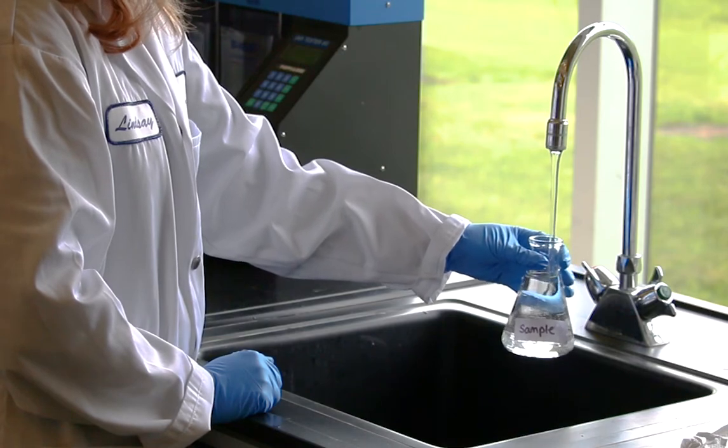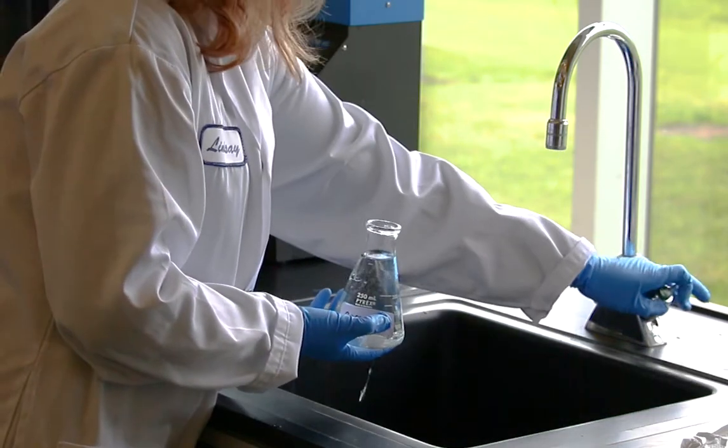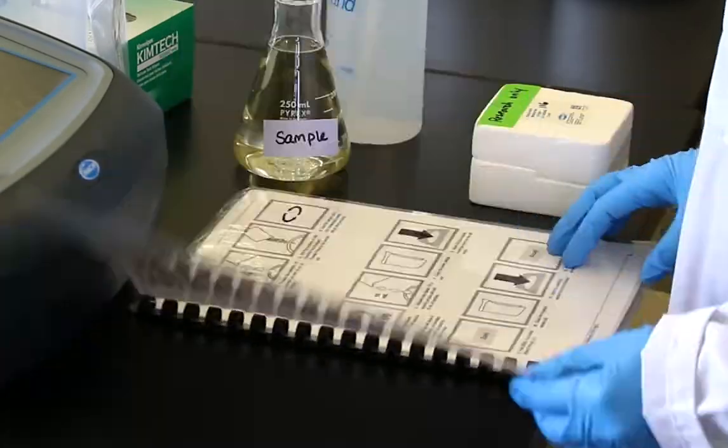In this test, the reagent converts the soluble and insoluble iron to soluble ferrous iron for measurement.